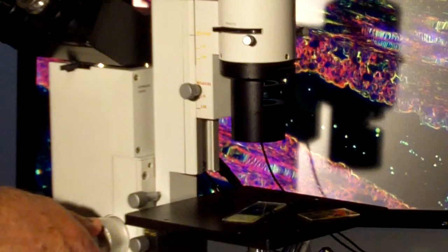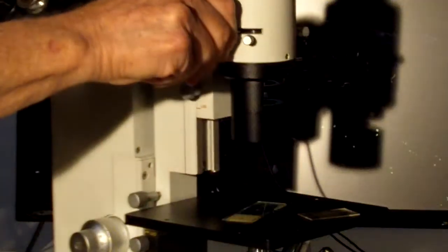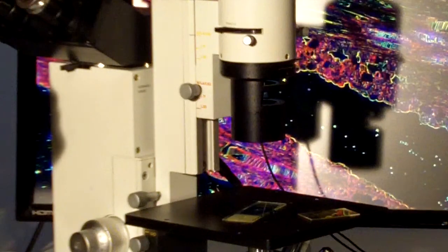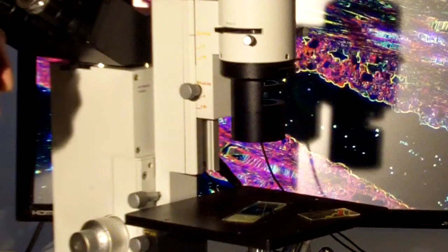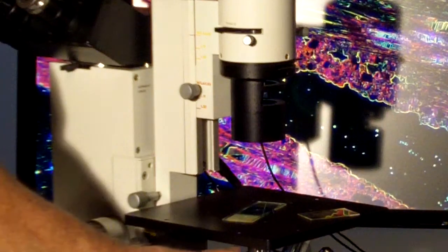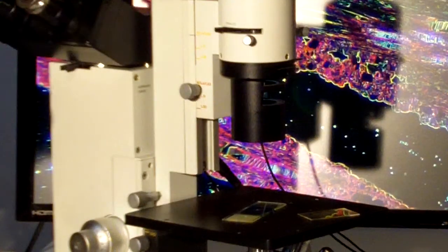As you can see, there's all kinds of tricks we can do with the phase ring that we normally would use for phase contrast. And that includes creating dark field using low mag objectives. In this case, we're using a 4x low power objective.